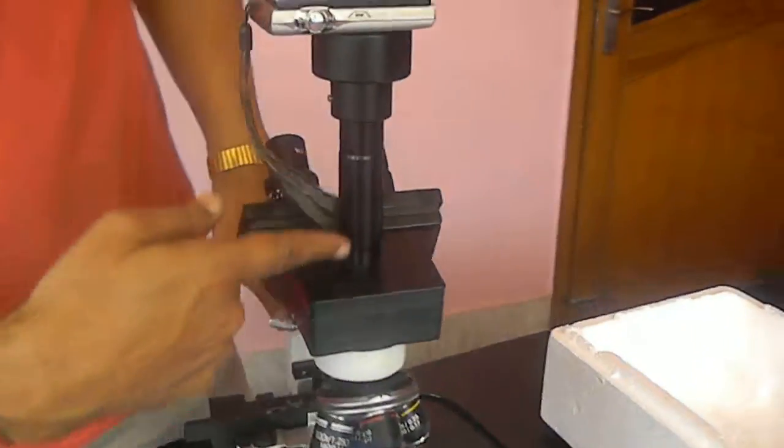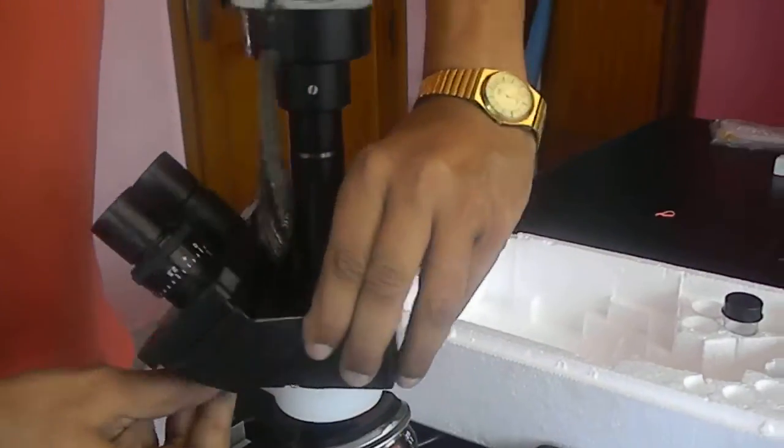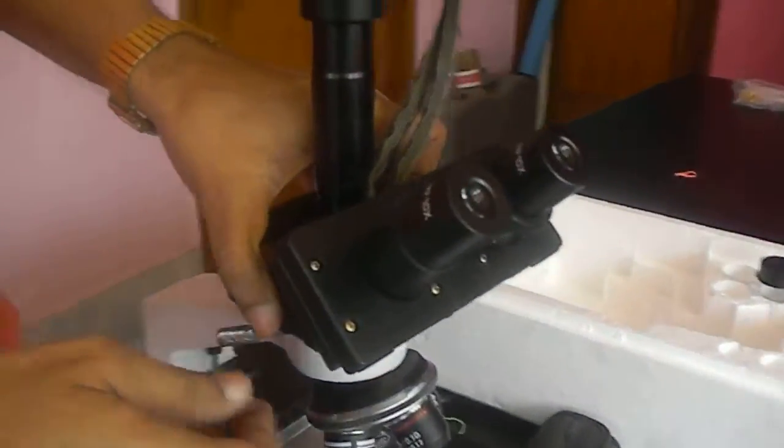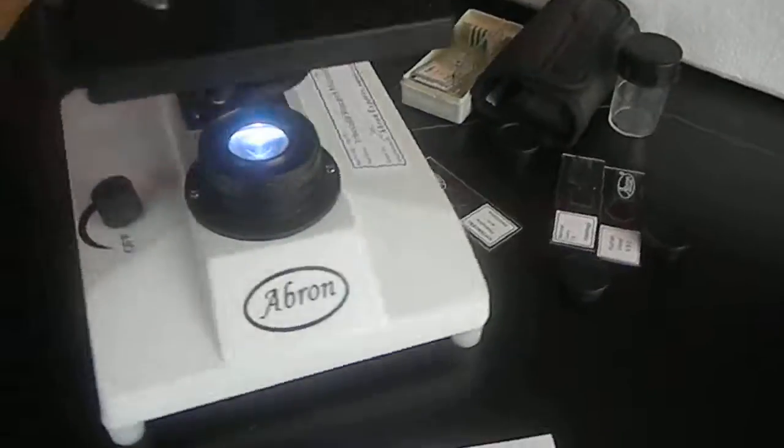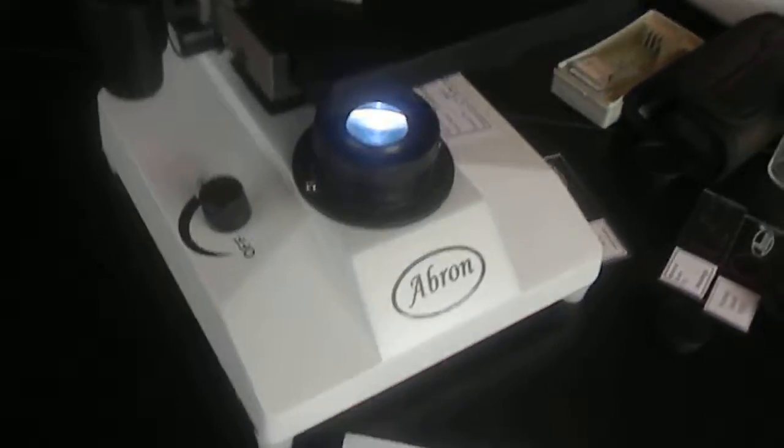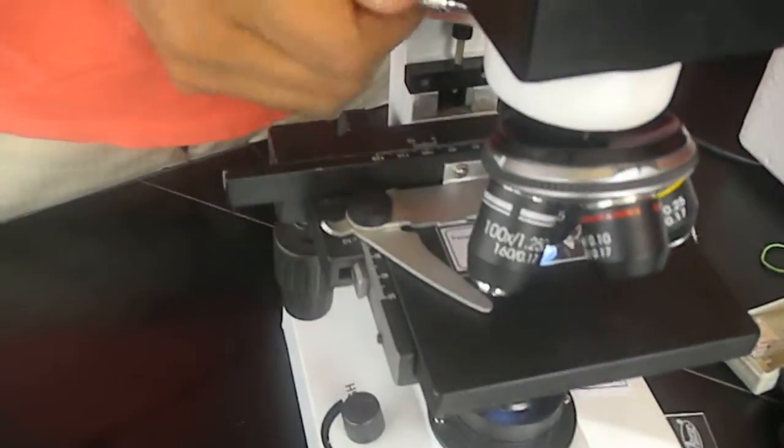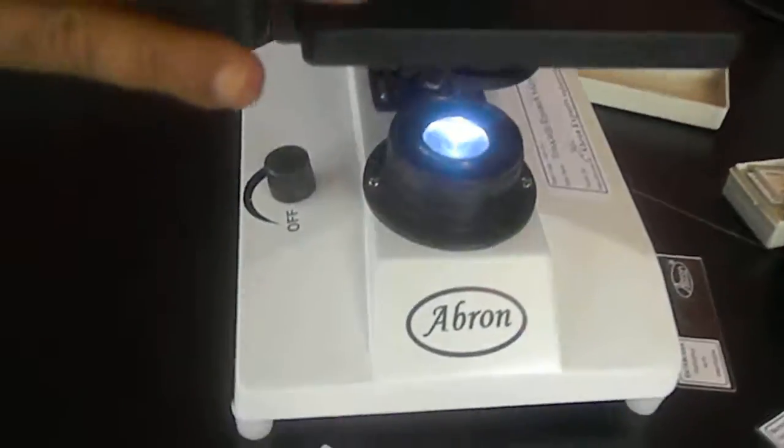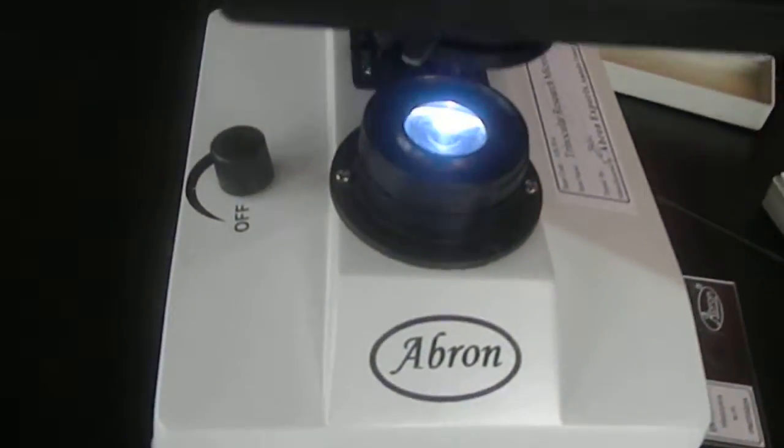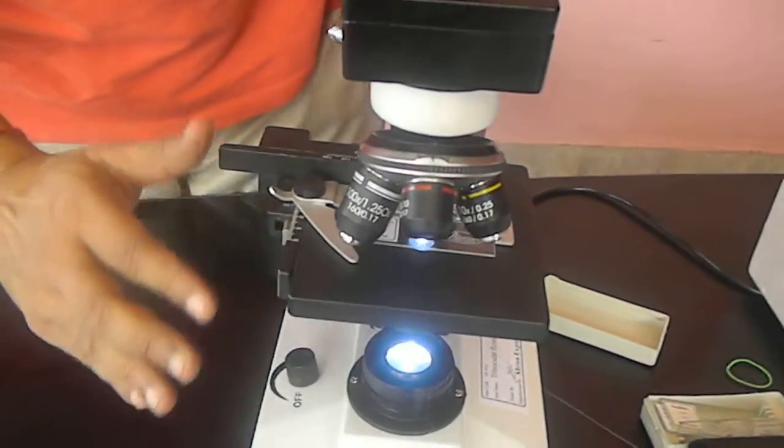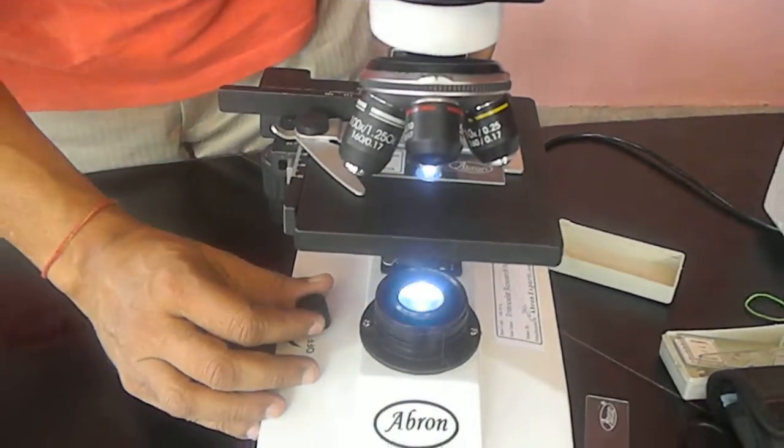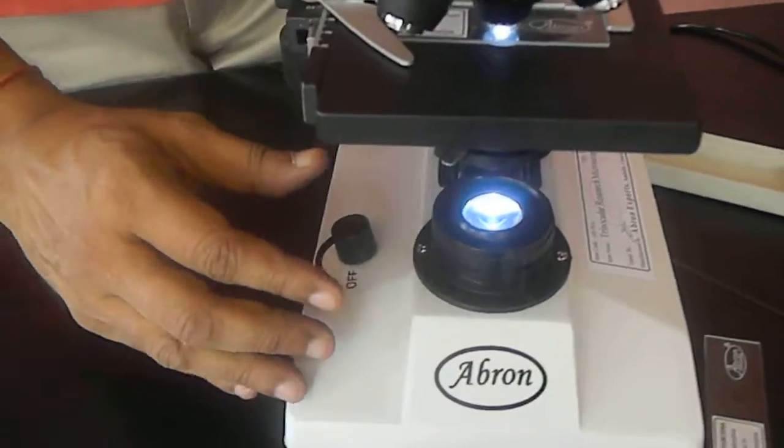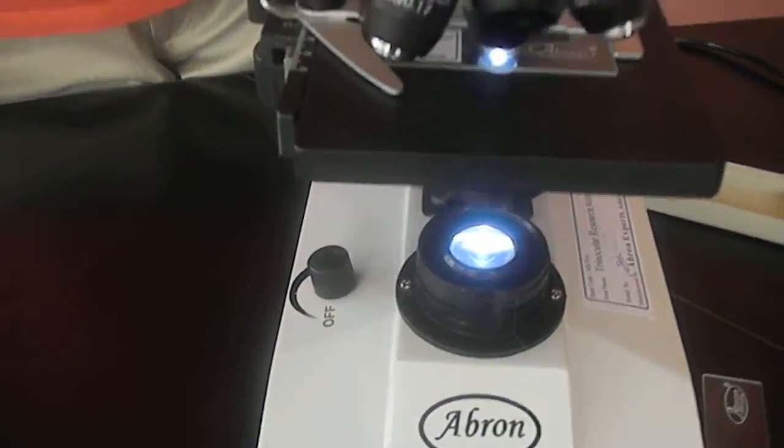Second is this tube is there. You can put the same like this. If you have the habit of using from the front side like this or the back side. But I prefer the image is visible this way. So you can see from the other side and the image will be visible. These are the objectives. You can focus and do the experiment very easily. You can reduce the light better. Use the maximum light so that the maximum image comes on the screen.